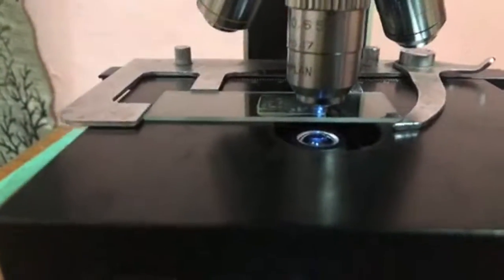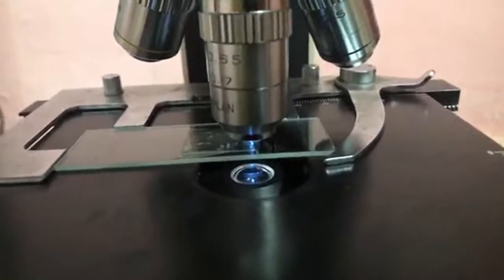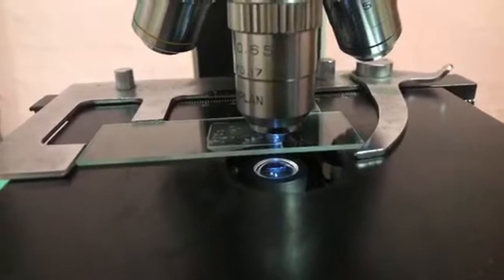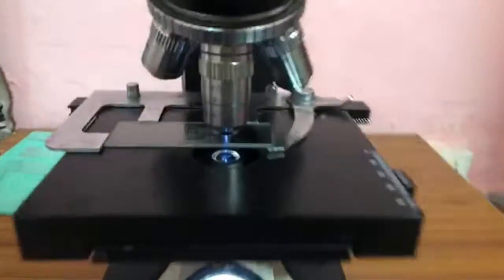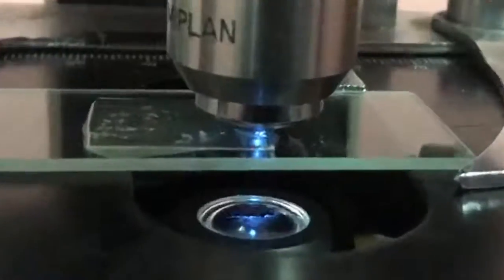So today it was a raining day, and I decided that I shall just collect some water from a shallow accumulation of water in the ground. And here we are, a little bit of water sample, which is here on the slide that you see.